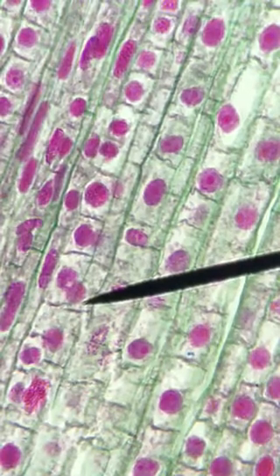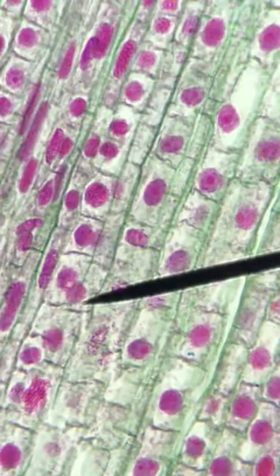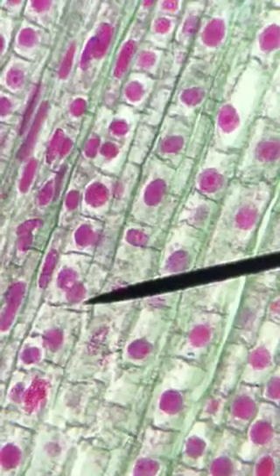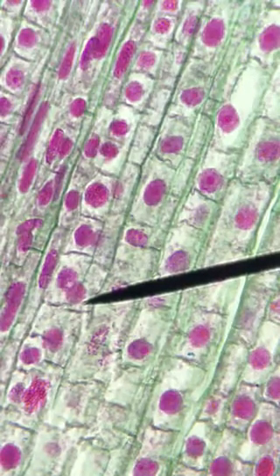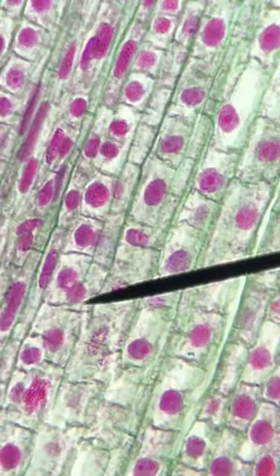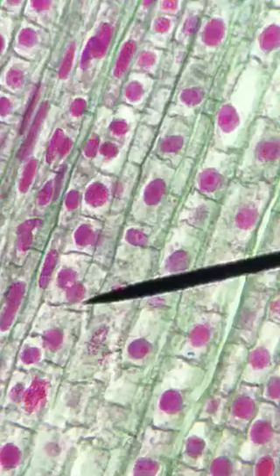Now, once you've tallied up how many of the cells were in prophase, metaphase, anaphase, and telophase, since there were 90 cells, you're going to find out the percentages of those cells in those phases. And once you find the percentages, you're going to use those percentages to calculate the amount of time. The entire cell cycle for this particular specimen is about 19 hours or 1140 minutes. So if you had, say, 50% of the cells in prophase, you would multiply 1140 by 0.50 and so forth. And that's how you collect your data.